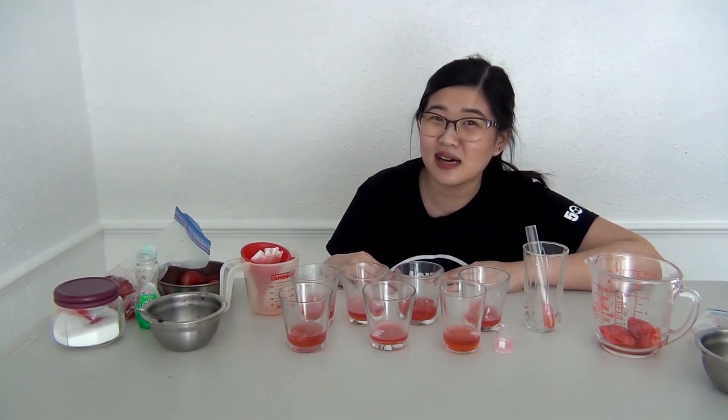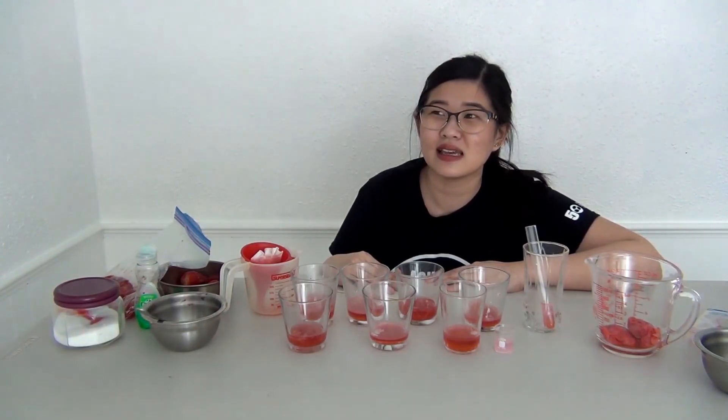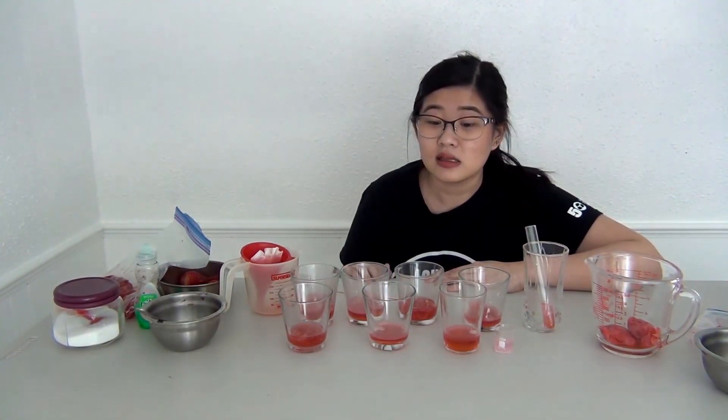I hope you had fun and learned how to extract DNA from plants. And by the way, that's a hot tip. Some plants, they are polyploid, meaning they have more than two copies of their chromosomes. So that might be a good place to start. And that's it. Do our challenge, extract DNA, have fun. Bye!